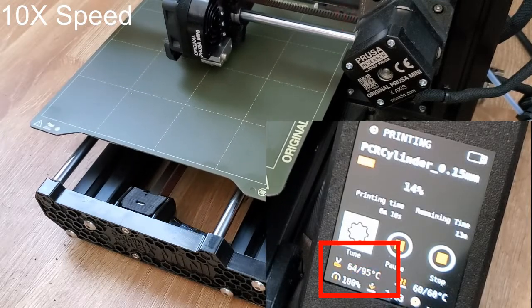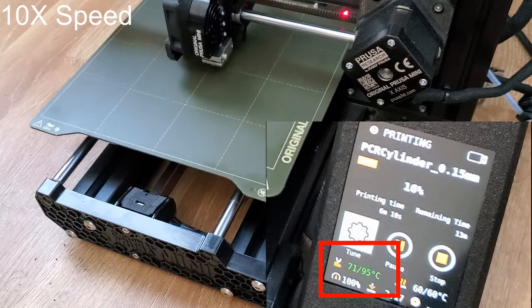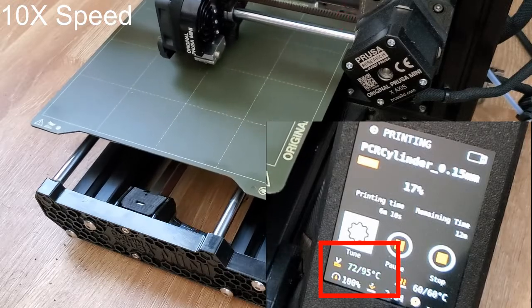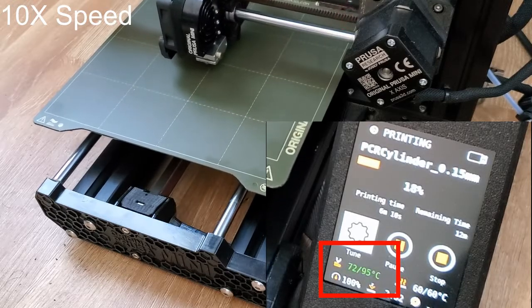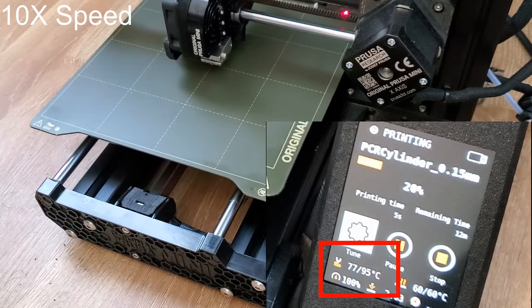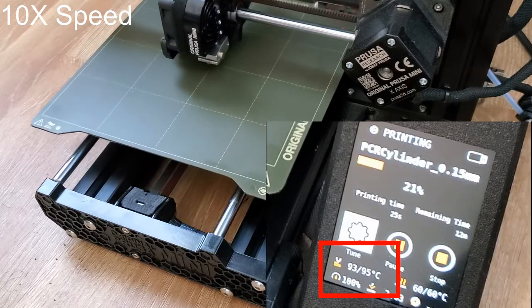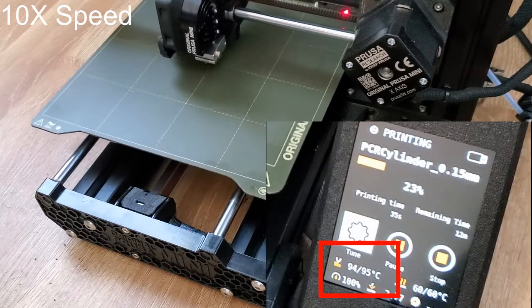The slowest operation seems to be cooling the hotend, since that's not a normal operation for the printer. If you wanted to improve it, you could probably just stick a fan nearby to help with convective cooling.